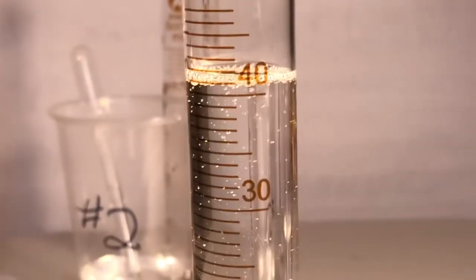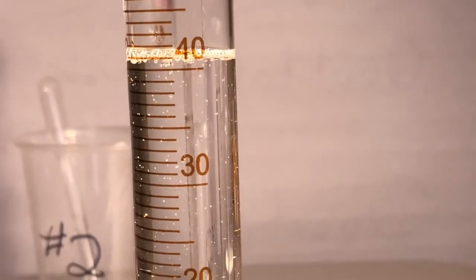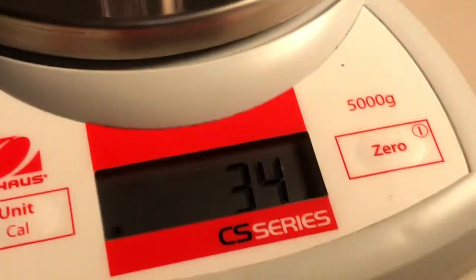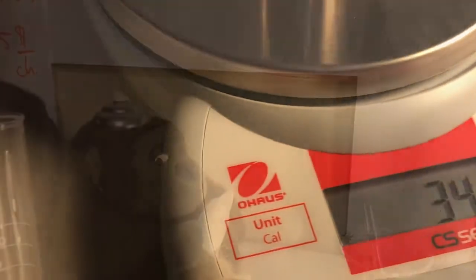All right, you. Couldn't get that last drop to fall. Crazy kids. Okay, got it. Got a number and a mass, please. And that should be 8. If I ripped you off and it's 7, well, you'll forgive me because you're nice. All right. That's 3.